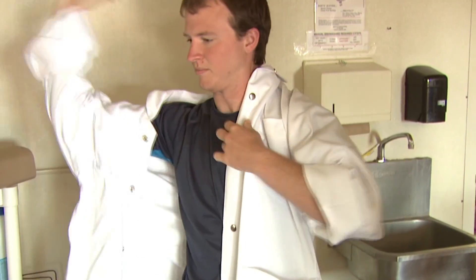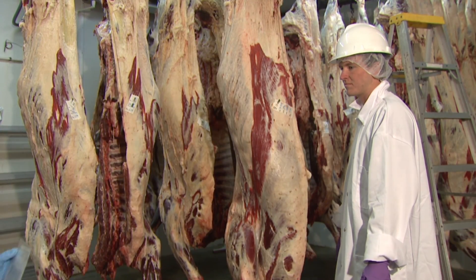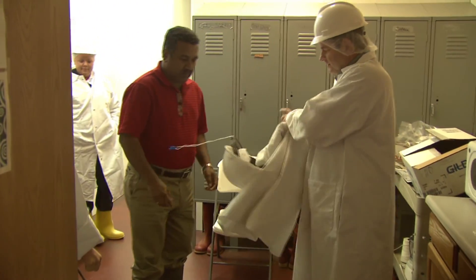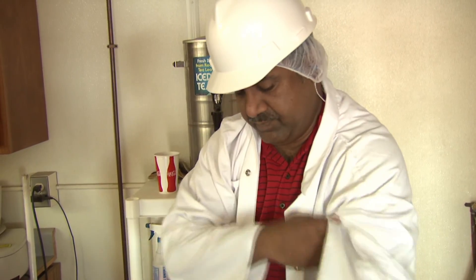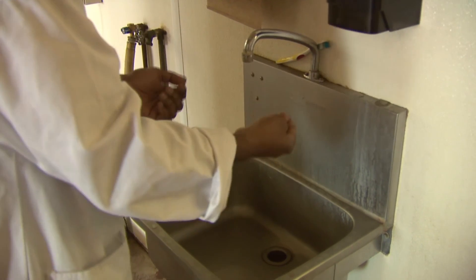The person designated to collect the generic E. coli sample should dress properly and practice good sanitary procedures to minimize cross-contamination. Some basic hygienic practices include removing all jewelry, then putting on a hairnet, a clean frock, hard hat, and steel-toed boots. Make sure the outer garments are clean. Handwashing is critical — thoroughly scrub and wash your hands up to the mid-arm with soap and water for about 20 seconds, then dry with a disposable hand towel.